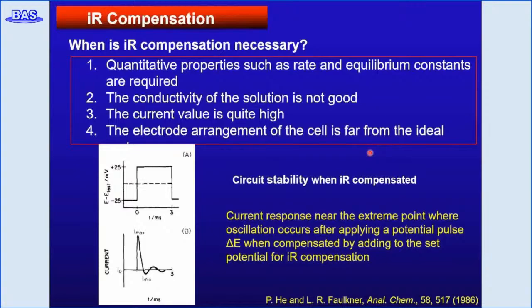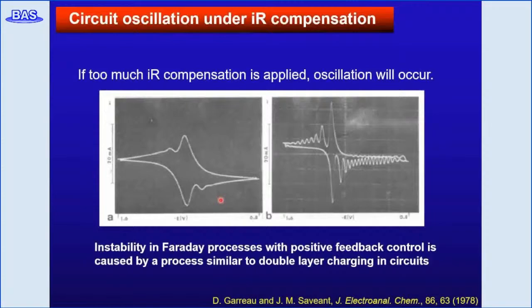Circuit stability is also important when performing IR compensation. Sometimes oscillation may be induced by the potential change when the positive feedback is applied. Here's an example of circuit oscillation under IR compensation. If too much IR compensation is applied, oscillation of the circuit occurs. On the left-hand side, the small second peak beside the main peak was due to the early stage of the oscillation, and on the right-hand side it shows that oscillation occurred.